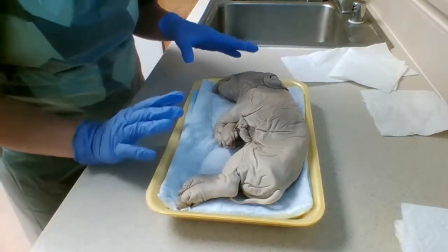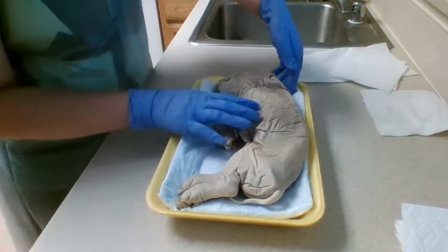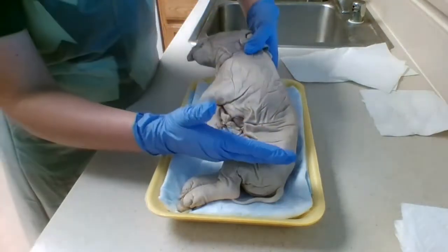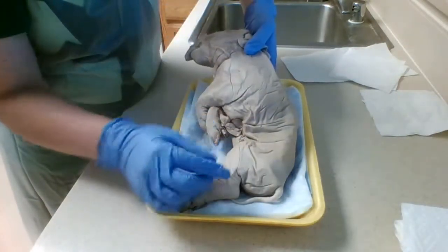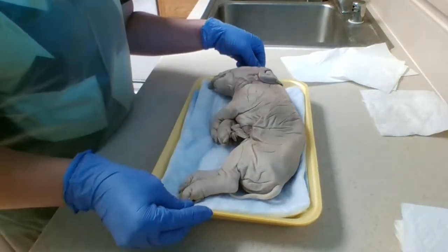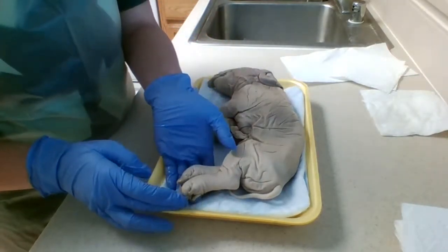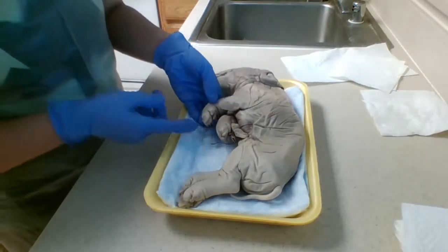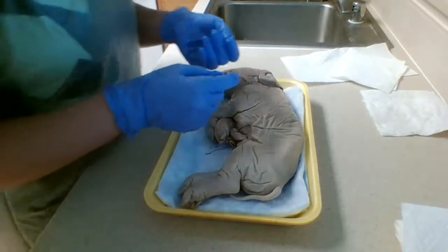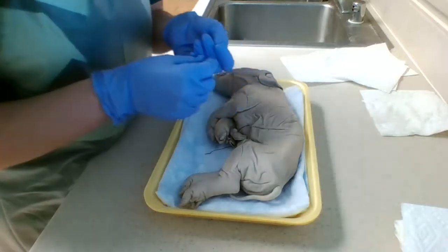I'm not sure how good of an angle this is for the video, but this part of the body here is going to be the head. I'll hold it up a little bit so you can see it better. This is the trunk of the body, from here to here, and this is the tail. We do have 4 appendages that include hooves. This would be appendage 1, 2, 3, and 4, and the hooves are on the end of each of them, here, here, here, and here. Identify the external ears, mouth, nose, and nostrils.